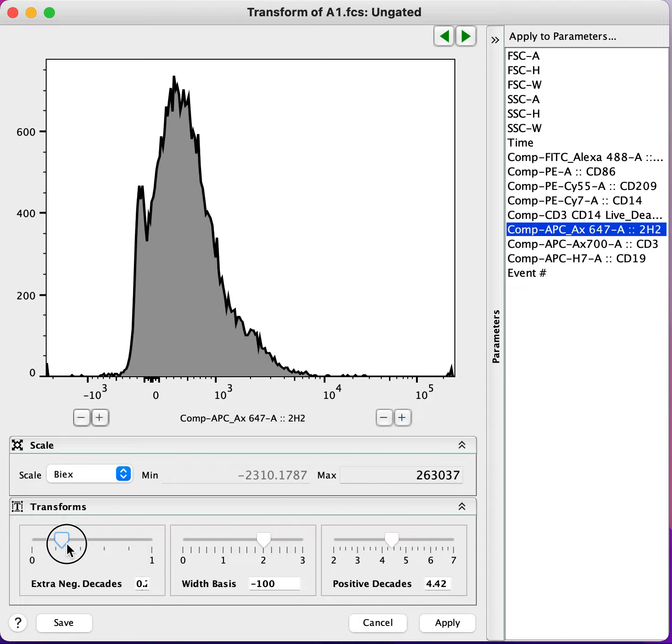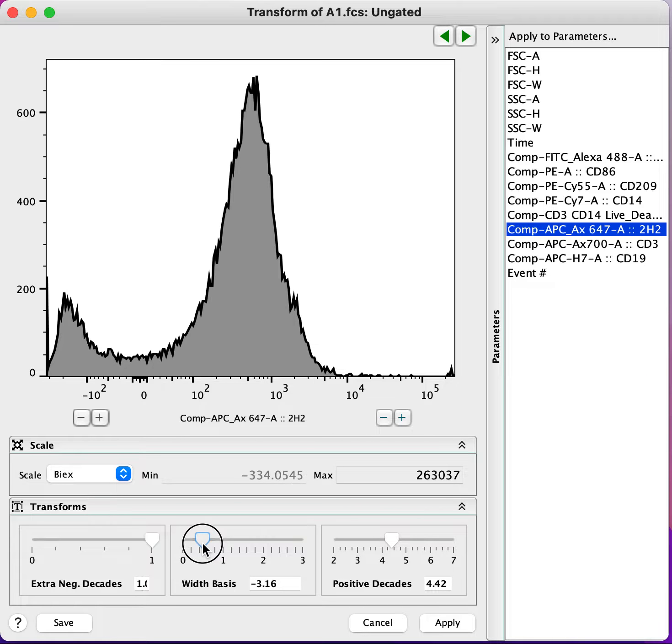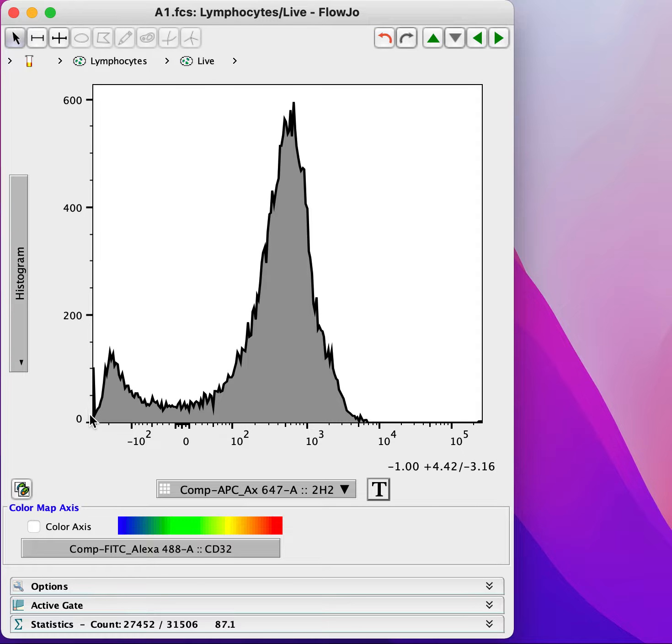So we're going to add an extra negative decade again and increase this width basis. So again, you can see that that's done the same thing, and we can see these two peaks here. We might be tempted to add a gate between them and call this negative and that positive. But you can see the division between these two populations is actually below 0 here. And so we know, because that's below 0, that that's not a valid interpretation of this data.